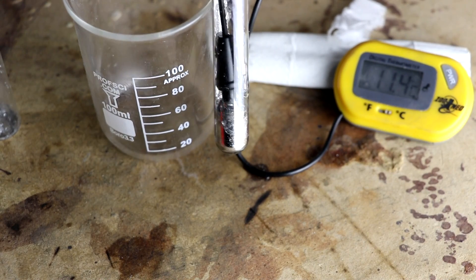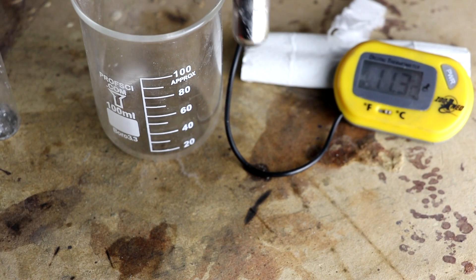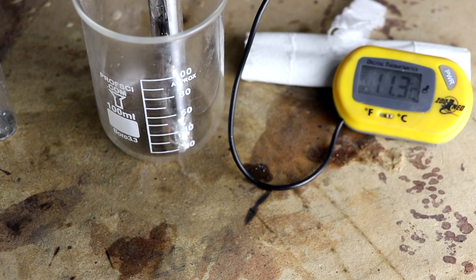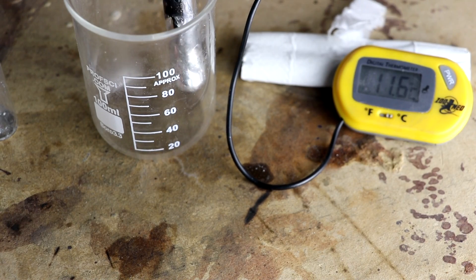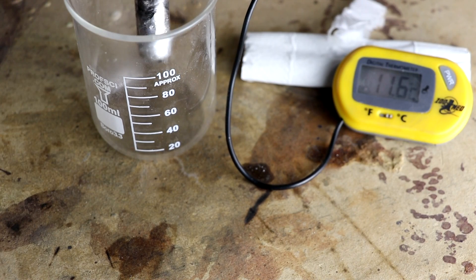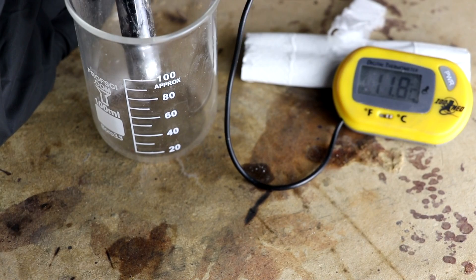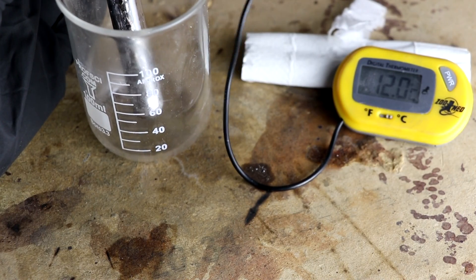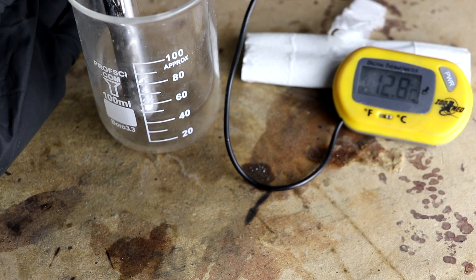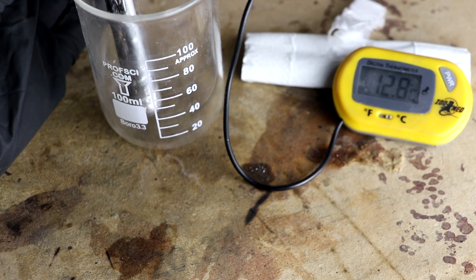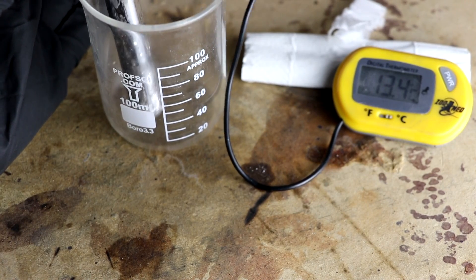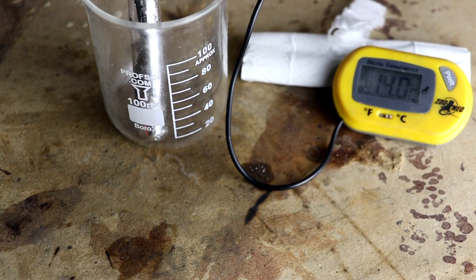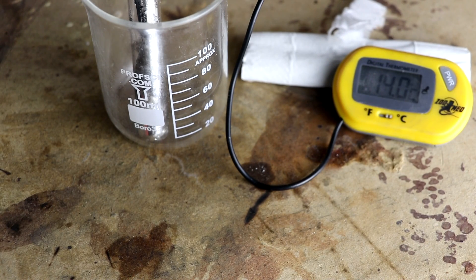I'm going to add in the sodium. There it is. Okay, now let's kind of stir around with the thermometer probe. Let's see what happens. I might have got too much kerosene in there and then to make good contact. It is warming up though. See if it is forming an alloy that is a solid and is not soluble in the liquid metal, then it should release the heat of fusion causing the temperature to increase. And I think that's exactly what's going on here. Cool.